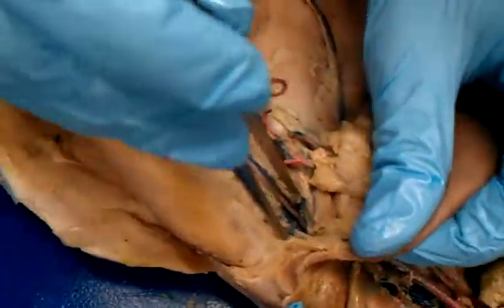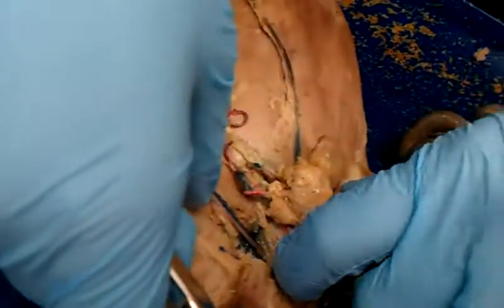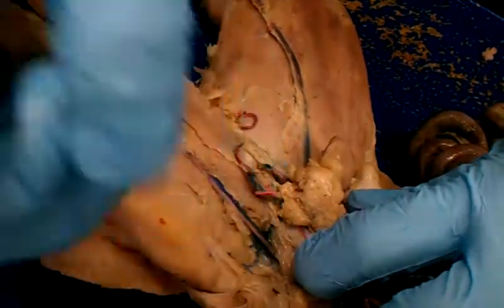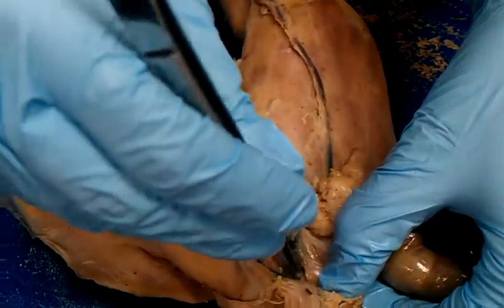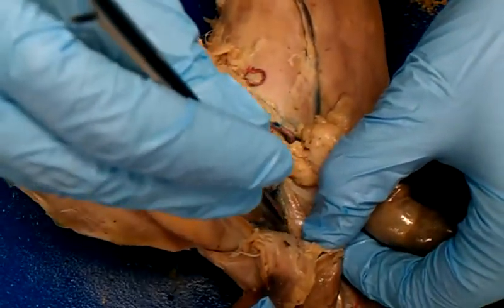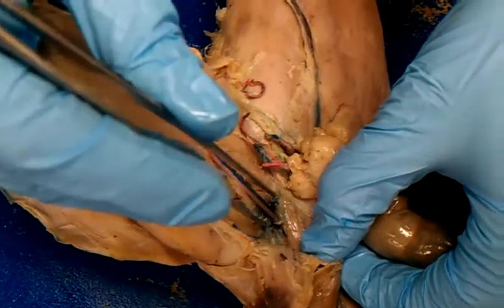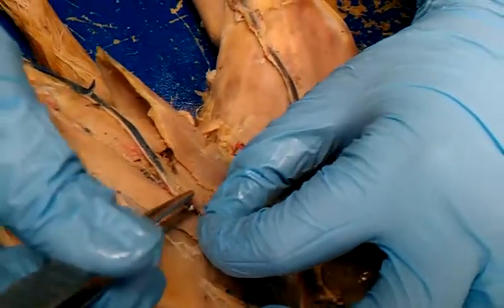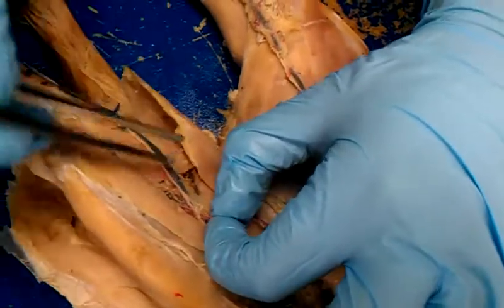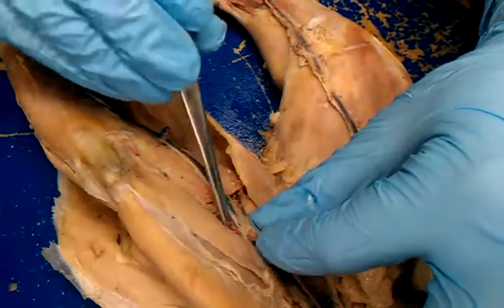And then on the other side of that, I think we got to kind of lift this part, is the deep femoral. It's like a little stub. I can't really see it right here, but it's like a little stub over here, right? Then this is going to be the femoral. It's going to branch off in two directions. This one right here is going to be the saphenous, and then going under to underneath the knee, we'll flip them.